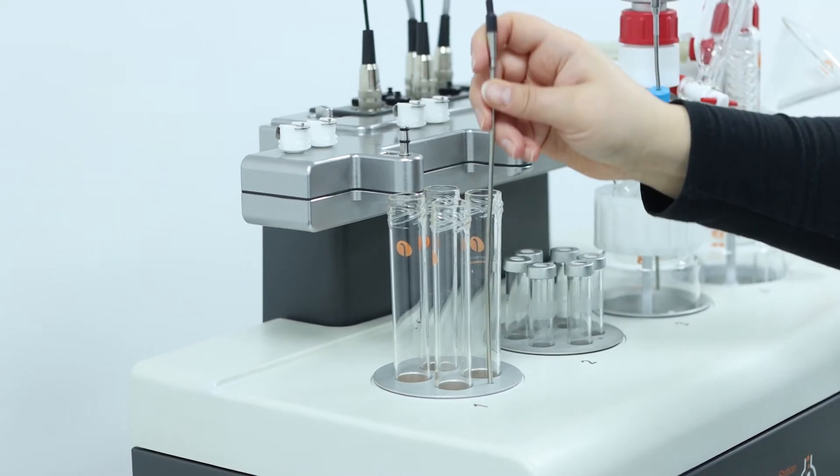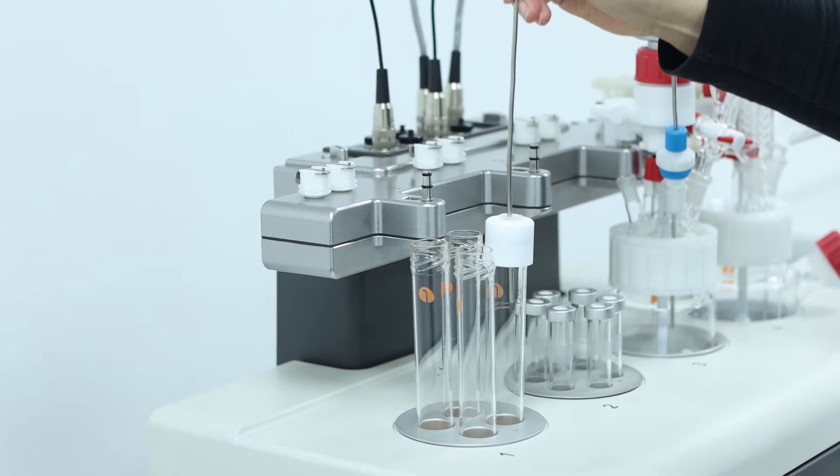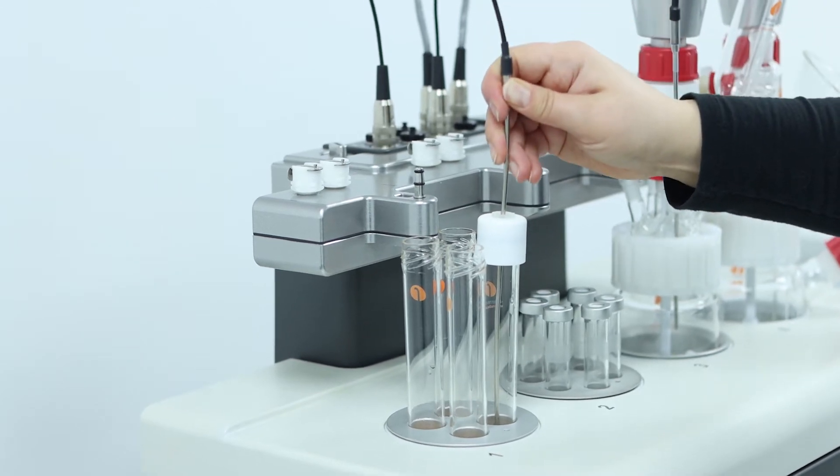Every multi-position insert has a temperature probe hole, but you can choose to insert the probe into one of the tubes if you prefer.